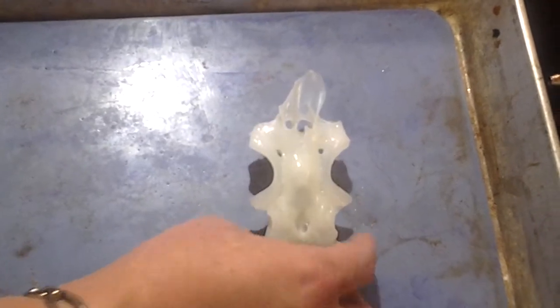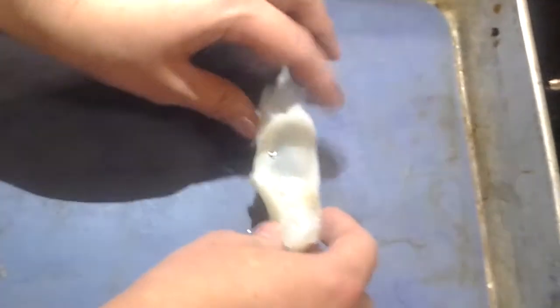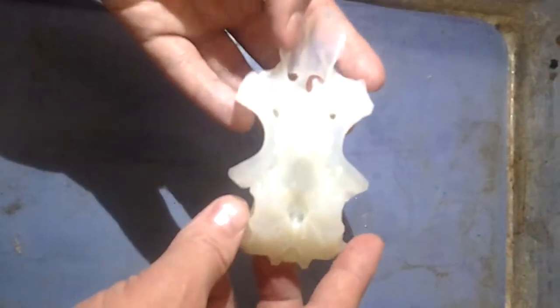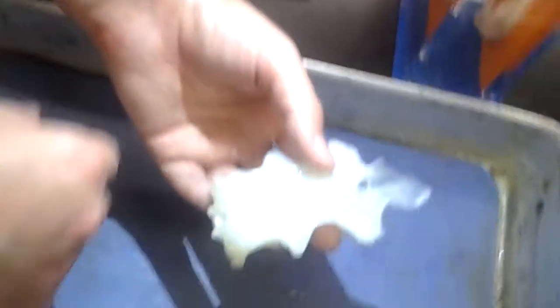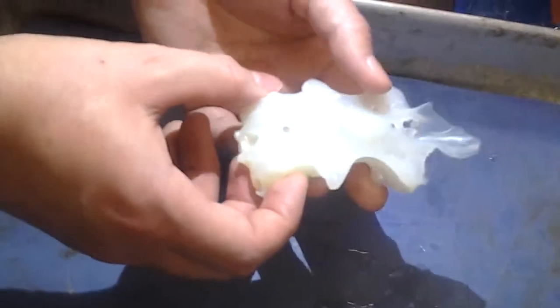Now, let's see what else we can see here. Okay, let's turn it on the side now. Do you know what this big hole is here? Optic nerve foramen. Yeah, this big hole here is the optic nerve foramen. All right, superficial ophthalmic foramina are here. Remember the superficial ophthalmic nerve? They all come up through here. Now, the endolymphatic and the perilymphatic foramina are inside the endolymphatic fossa. So the first one is endolymphatic, and the posterior ones are the perilymphatic.